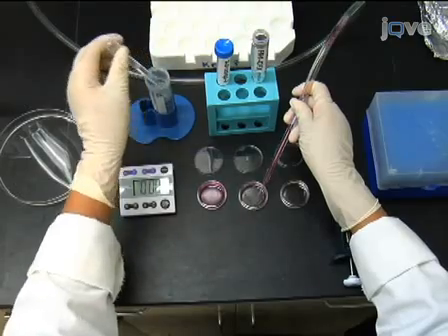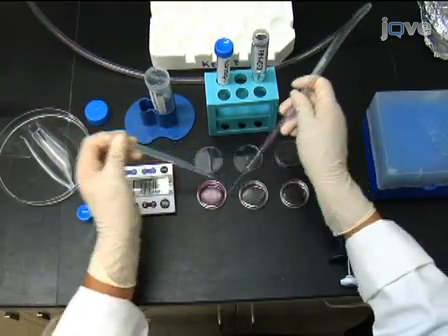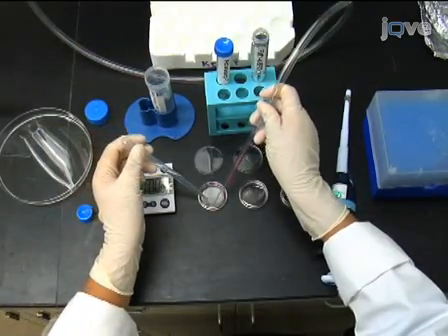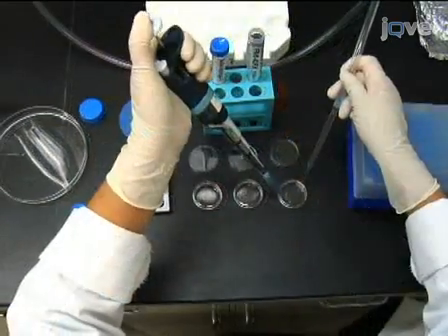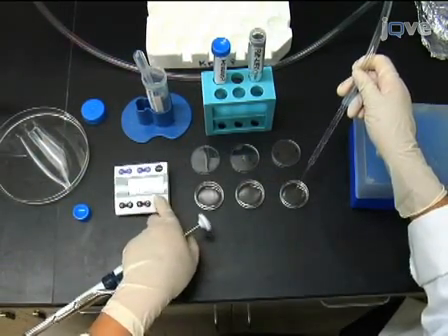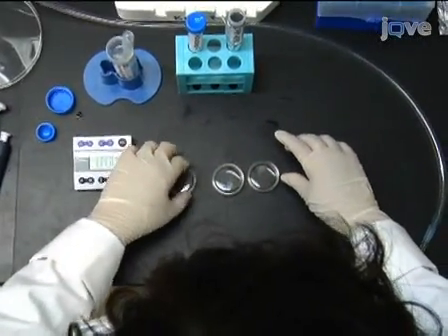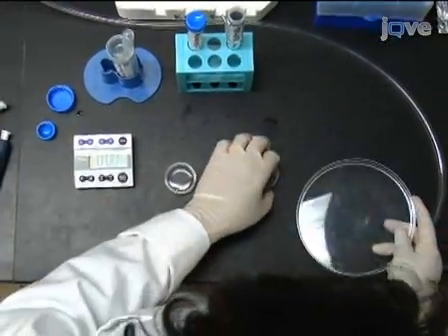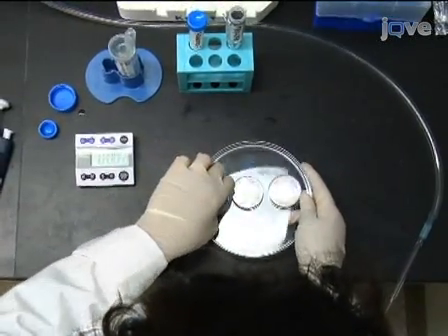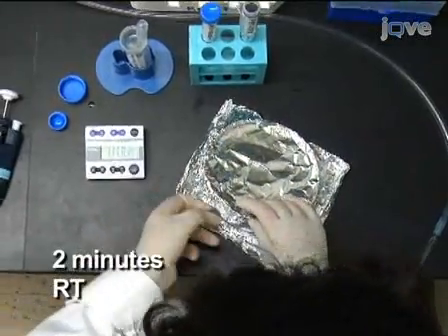Replace the culture medium with a buffered saline solution containing 45 millimolar potassium chloride and 10 micromolar FM1-43FX dye. This solution should also contain NBQX and APV to prevent recurrent signaling. It is important that the FM1-43FX stock solution and experiments be kept in the dark to prevent photobleaching, so cover the culture dishes with foil for all subsequent incubation steps. Incubate for exactly 2 minutes at room temperature.